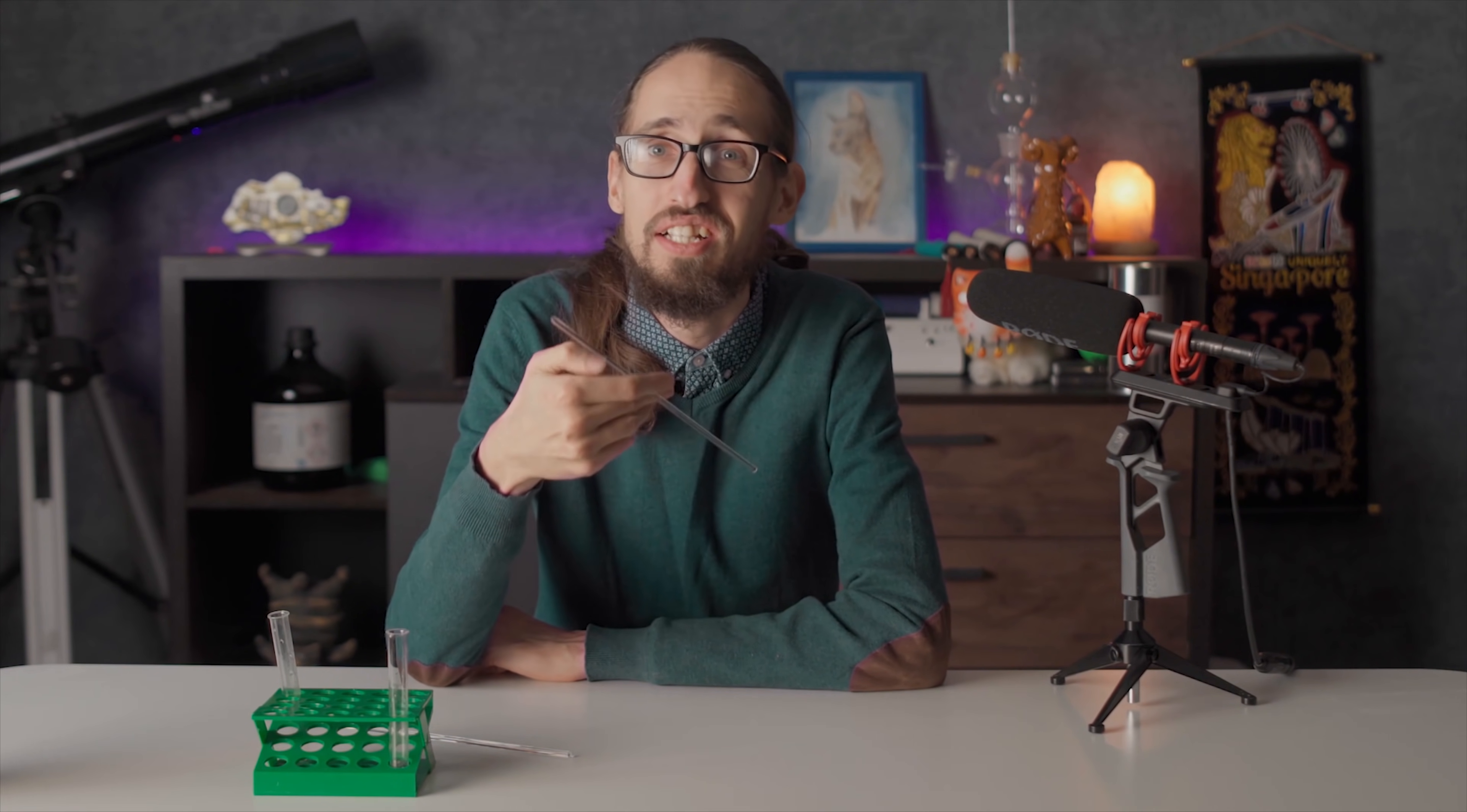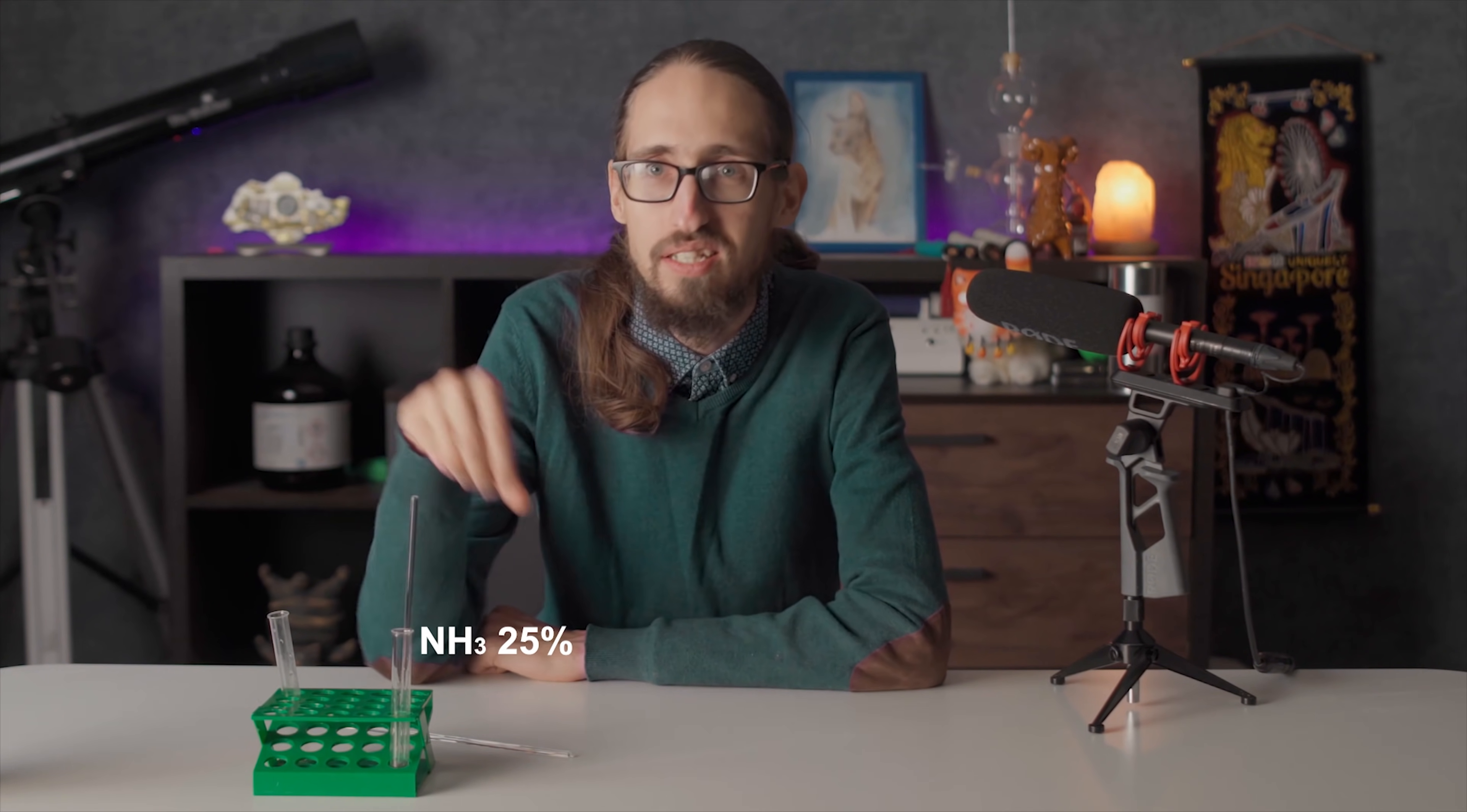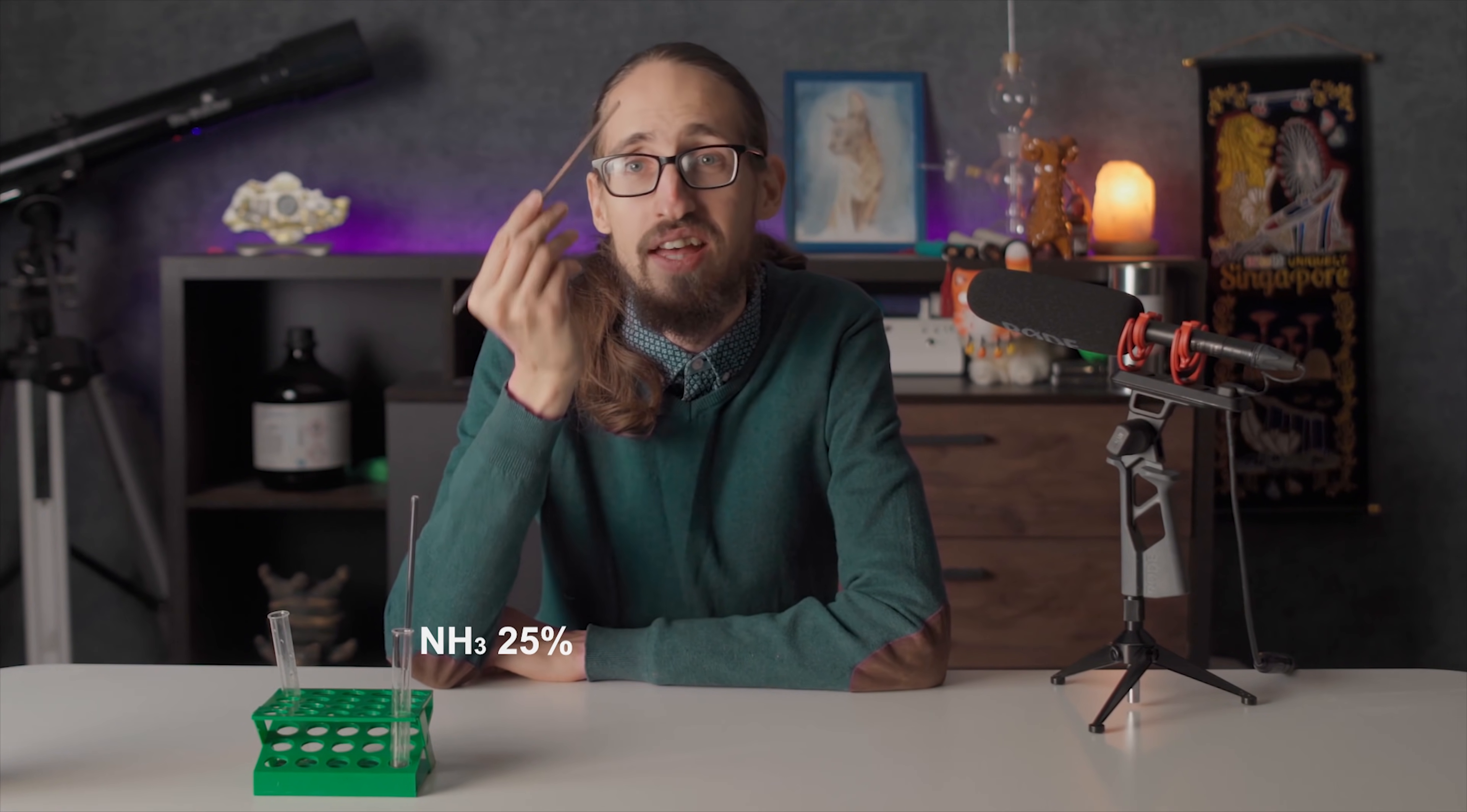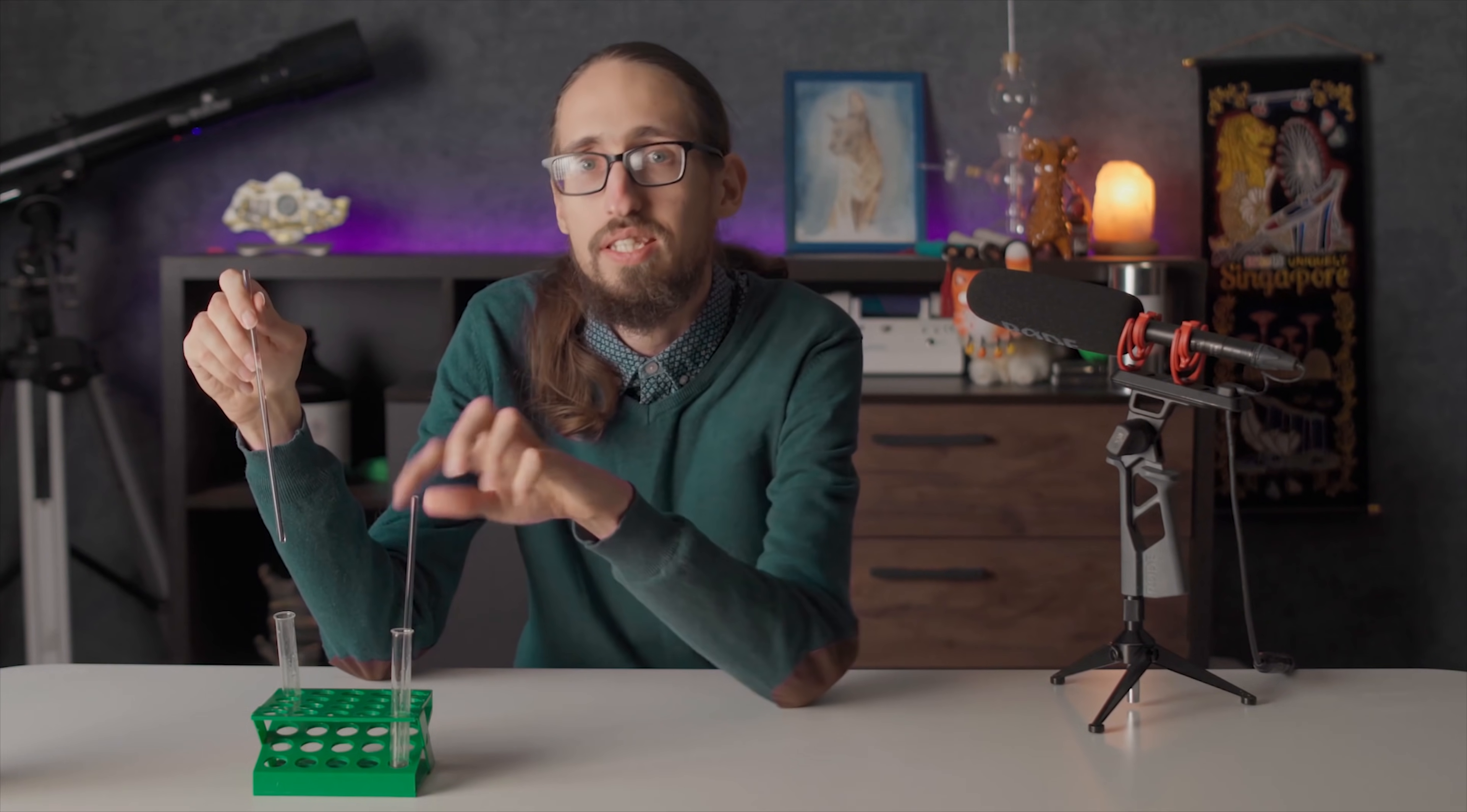Hey guys, you all know that classic experiment they show us at school with one glass stick soaked in aqueous ammonia solution touching the other one soaked in hydrochloric acid, which causes white smoke to appear.